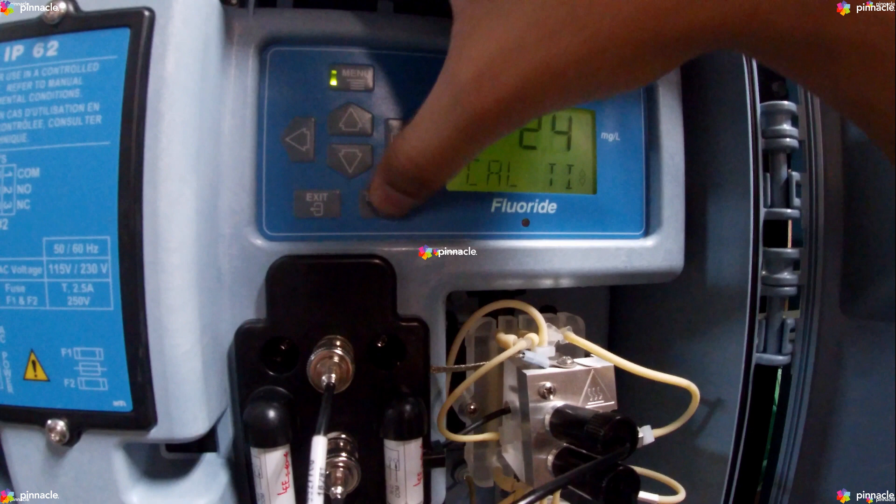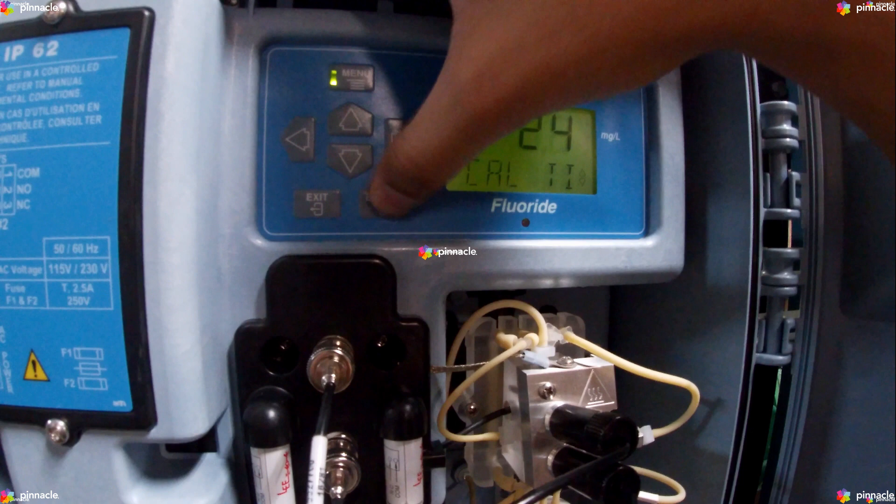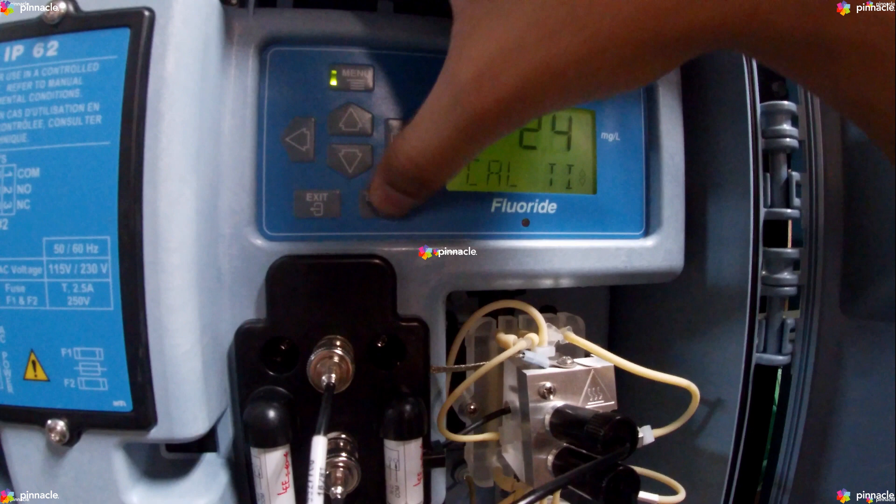The DefaultCal option sets the slope to negative 58 millivolts, the Offset to negative 15 millivolts, Standard1 to 0.5 milligrams per liter, Standard2 to 5 milligrams per liter, and CalTime to 24 hours.